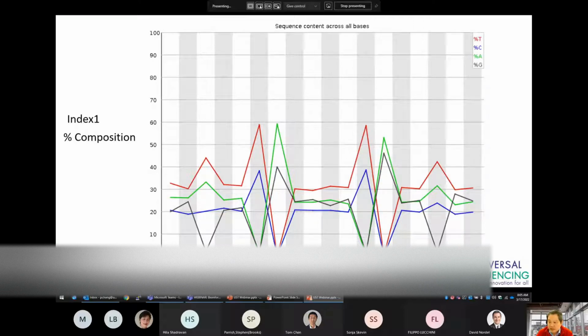UST uses a barcode signature with specific nucleotides at positions 3, 6, 7, 12, 13, and 16 of the index. This analysis here shows that these base positions carry the nucleotides that we expect, and you should see this as well for all indices in your samples.